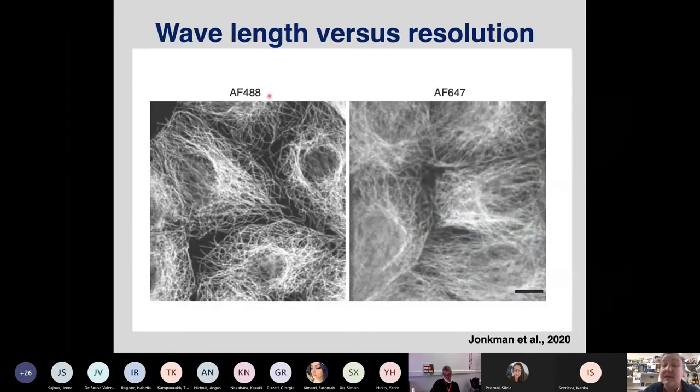But you have to consider the physical properties. And one of the physical properties, where it's the law of nature, is shown here in two different staining approaches. We have always visualized tubulin, and on the left-hand side, visualized tubulin with Alexa Fluor 488, so in green. On the right-hand side, the only difference is a different secondary antibody, which has a different fluorochrome. And you can see that it's not quite as crisp. This is a particularly bad example in comparison, but that's just something that you may have to take into account, that for conventional fluorescence microscopy, the green is often your friend.